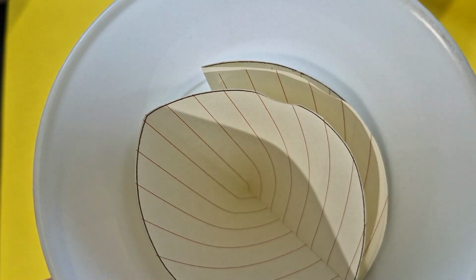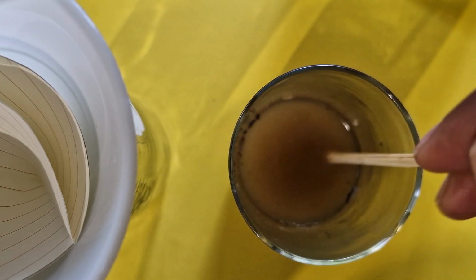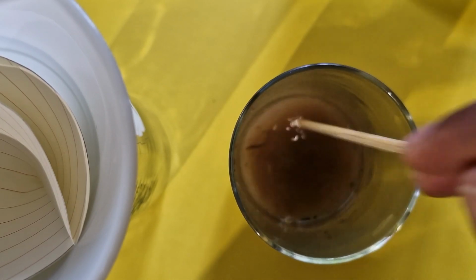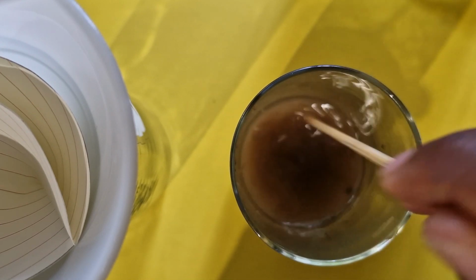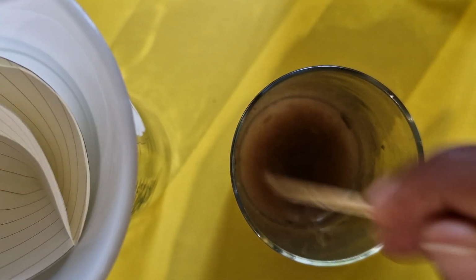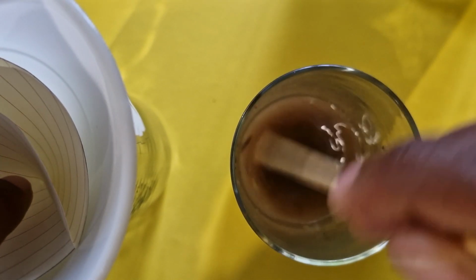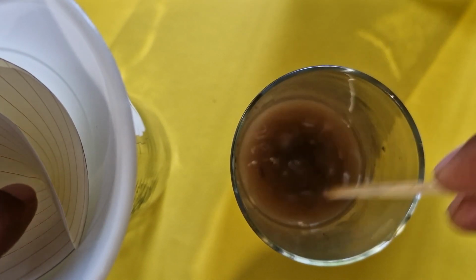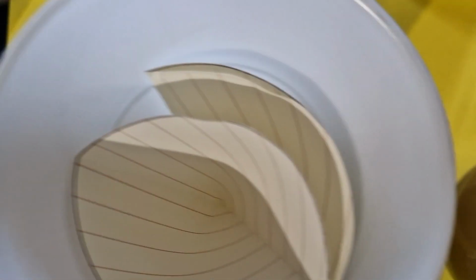So there you are. Then we're going to take the mixture that we have, that solution with your sand and sugar, or a sugar solution with sand in it, right? And I'm just going to pour it over my filter paper and just observe what happens, right? Let's hope this works.